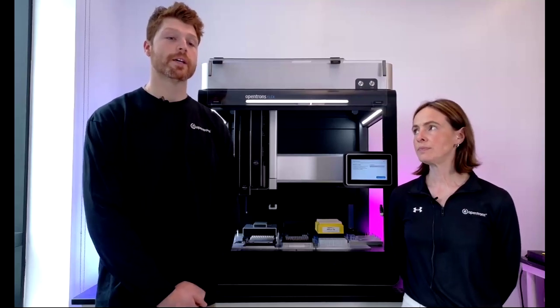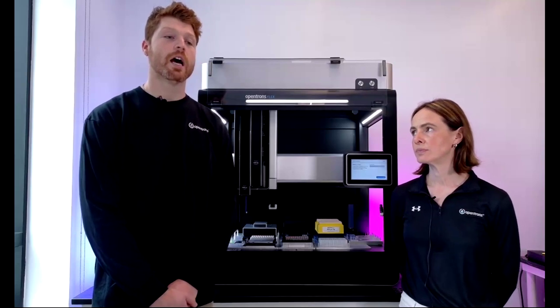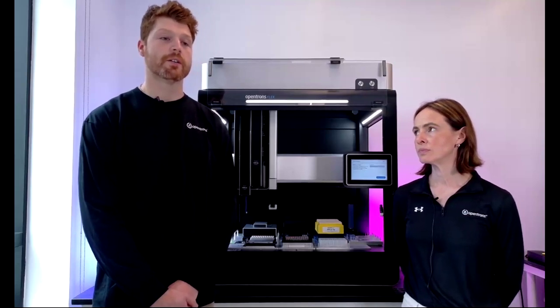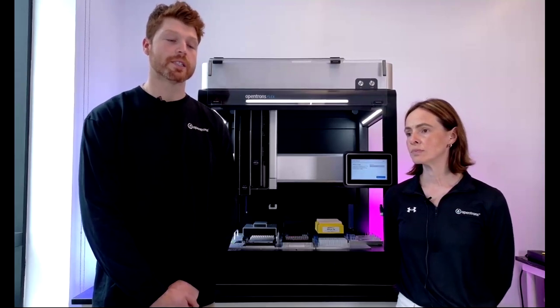Great. Is there a way to remove a supernatant from a pellet with minimal loss for a plate-based assay? So I would probably specify here that, to go back to one of the earlier questions, we do have encoders on all of our pipettes that give us pretty exact measurements on the Z heights.